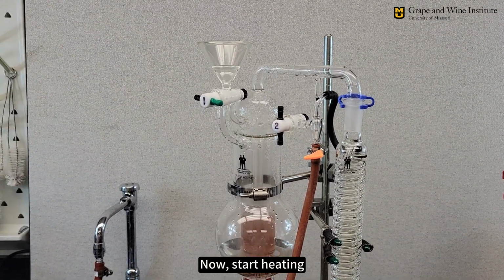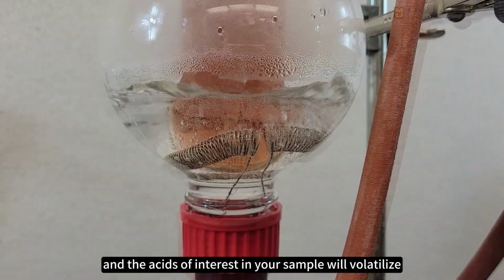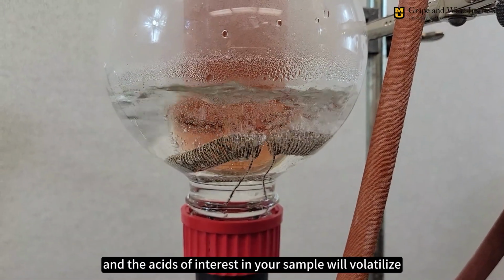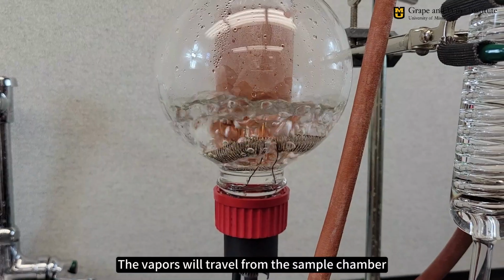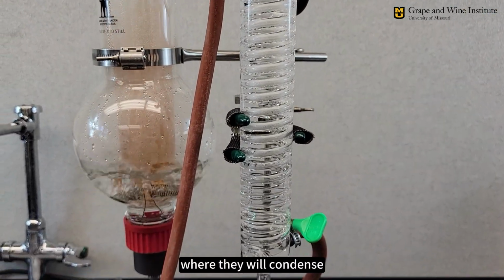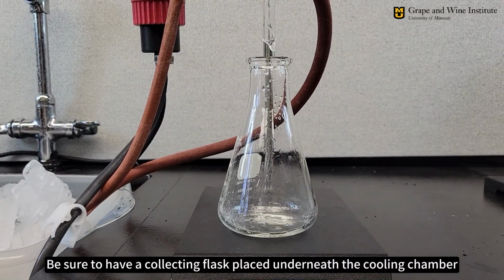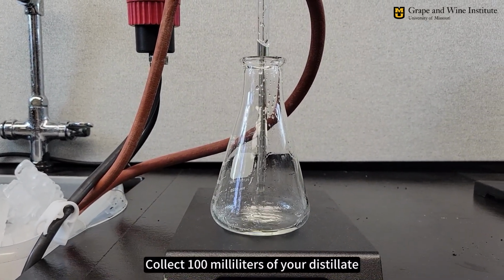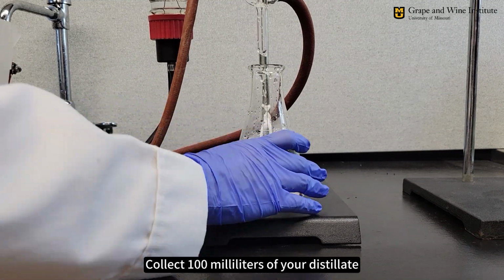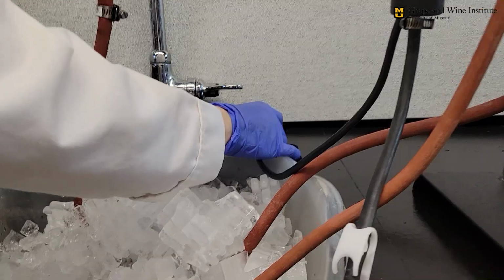Now start heating. As the coil heats, the water will reach boiling point and the acids of interest in your sample will volatilize. The vapors will travel from the sample chamber, through the coil in the cooling chamber, where they will condense. Be sure to have a collecting flask placed underneath the cooling chamber. Collect 100 milliliters of your distillate, then replace the flask with a waste container and turn off the power.